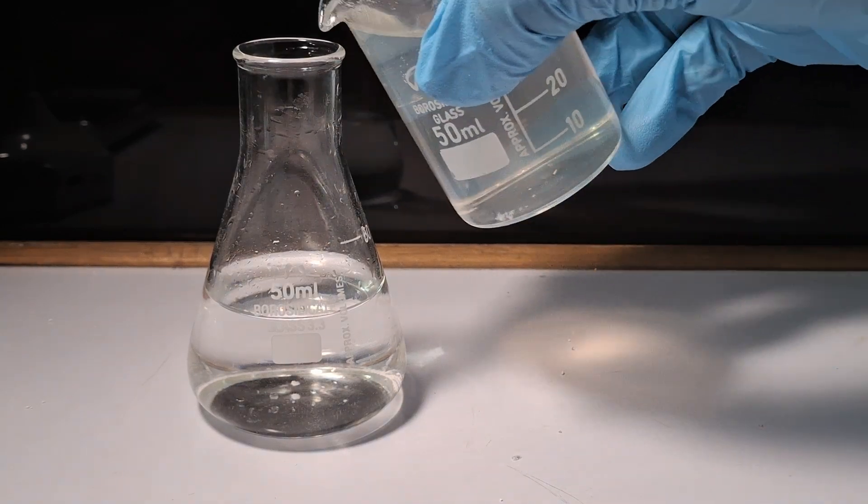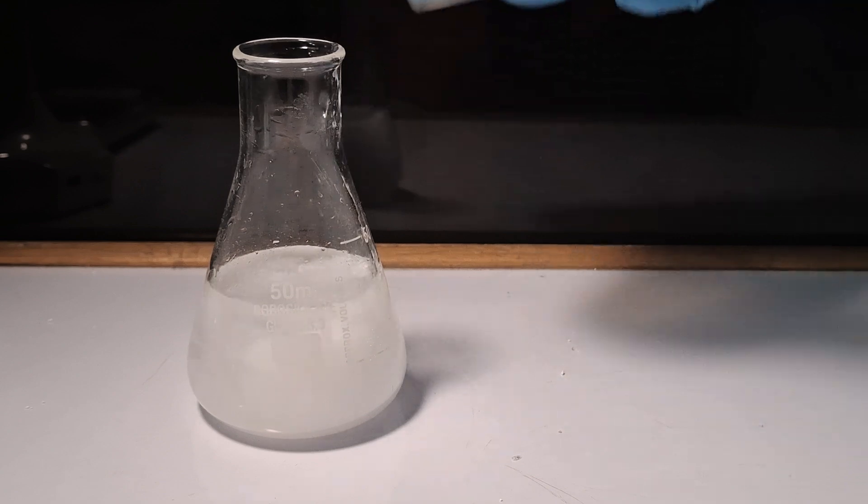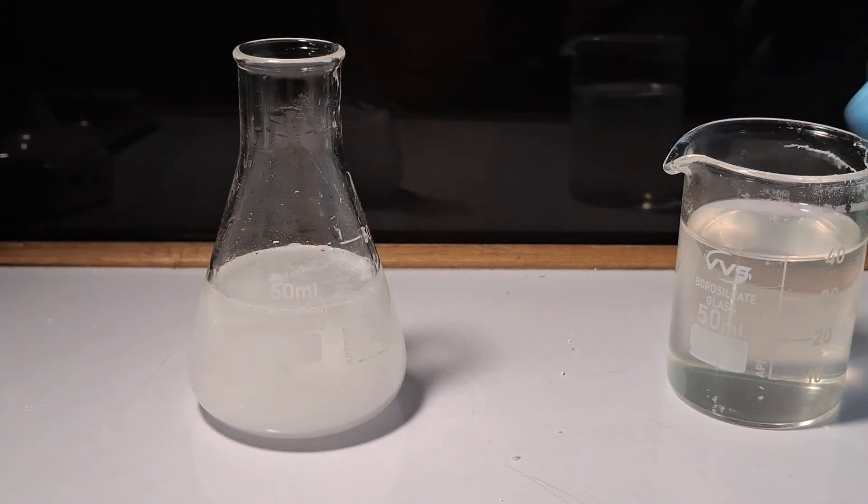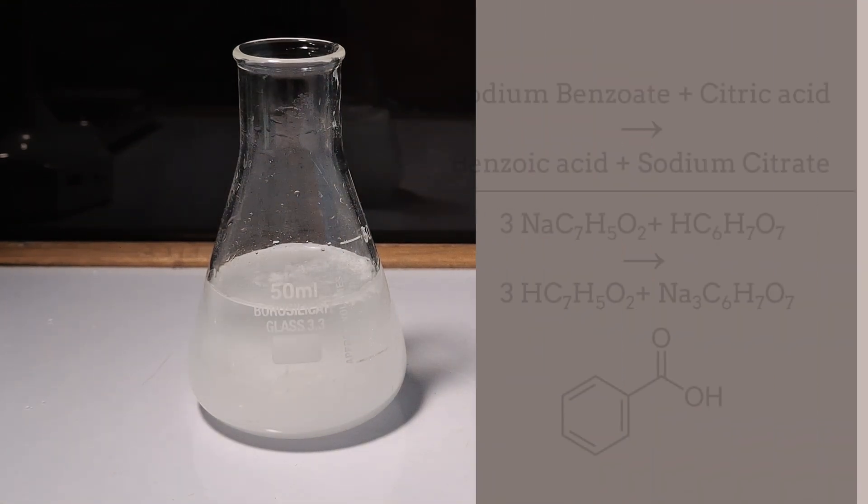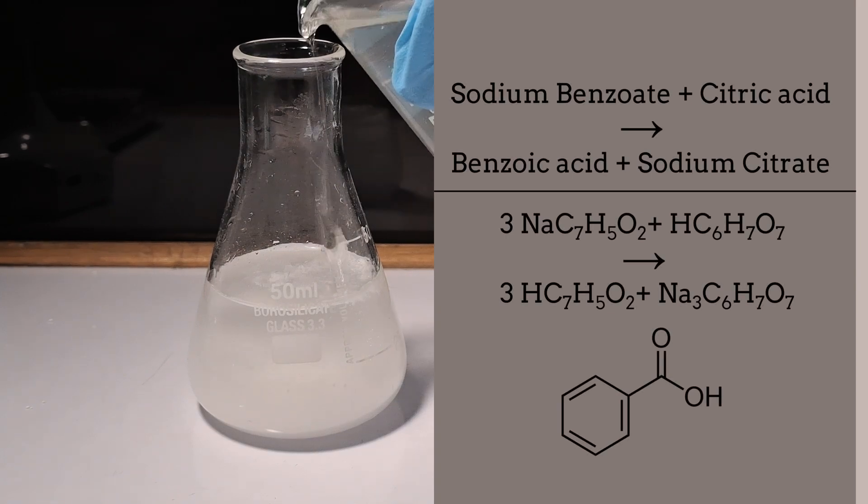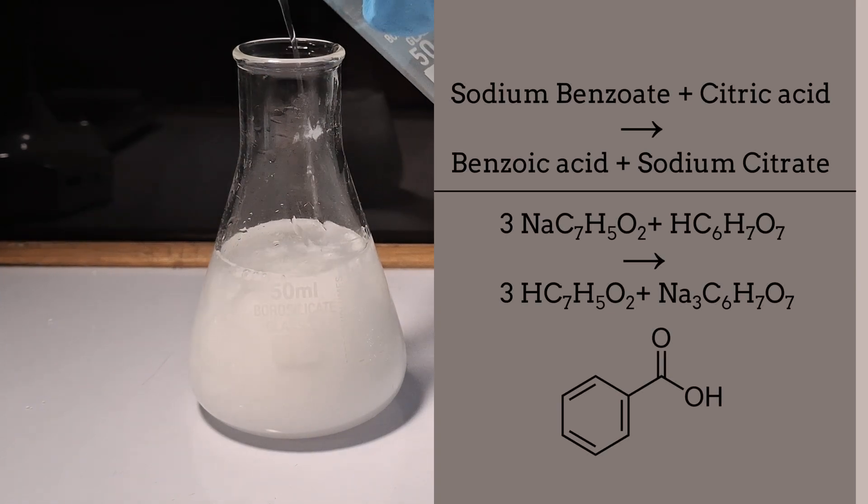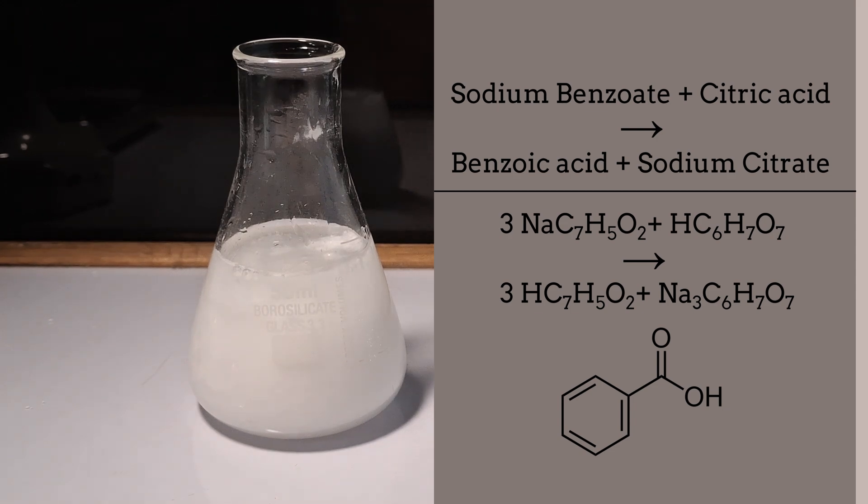As soon as the two solutions mix, a milky white precipitate is formed. This is the benzoic acid. This is a double displacement reaction in which insoluble benzoic acid and soluble sodium citrate is formed.